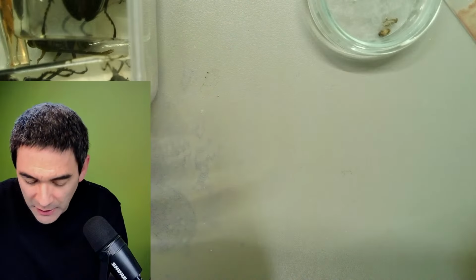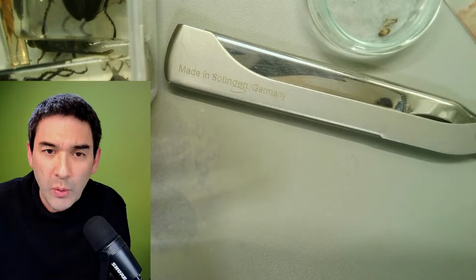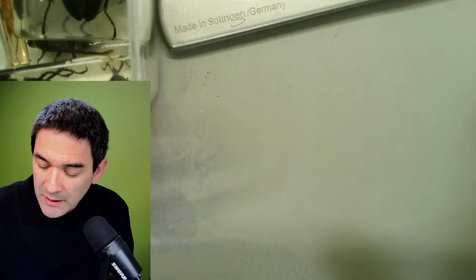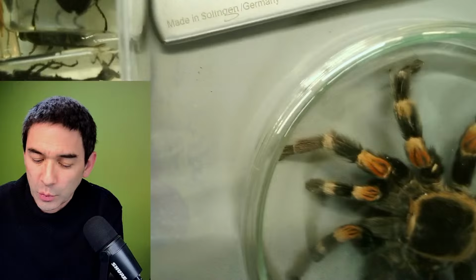What I'm going to show you now, and I know that if you're afraid of spiders, then please look away now. I'm going to quickly show you the tarantula. It is only the skin of the tarantula. It's not the full animal. And we've got two of these specimens in our school.